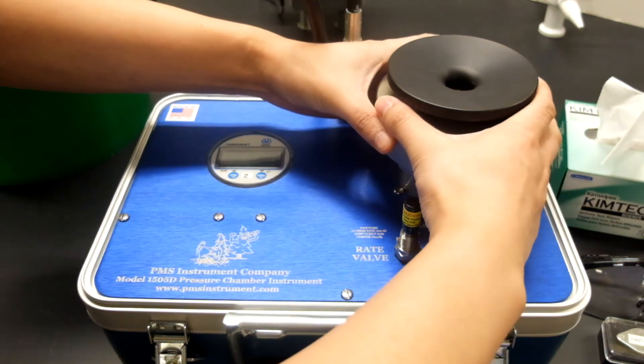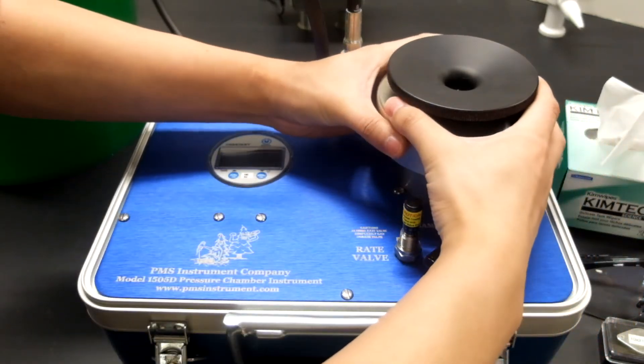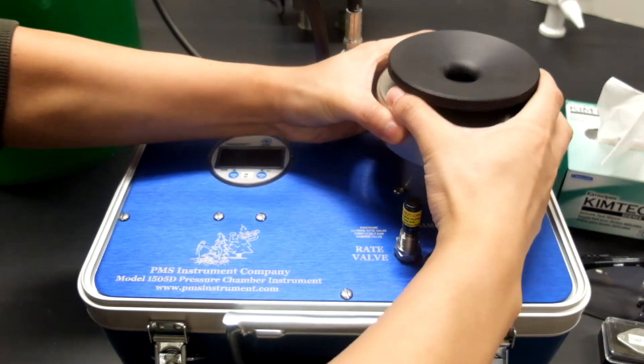To unlock the lid we have to press down, turn in a counter clockwise direction and then lift up.